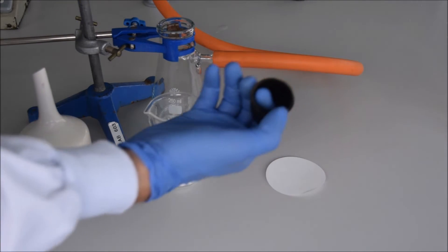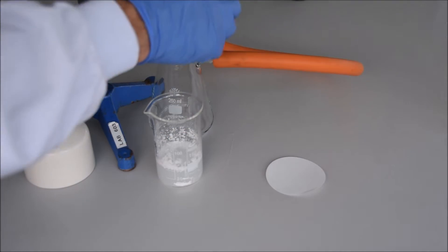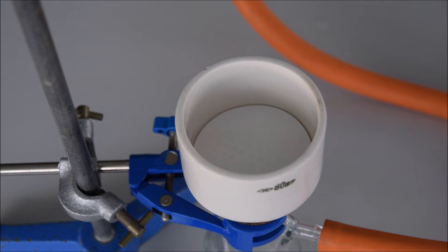Next, pop in your gasket and then put in the funnel itself. Once you've got the funnel in you can put in the filter paper and you're pretty much ready to go. You'll notice that I'm turning the vacuum on and off here, and it's important to have the vacuum running before you start to pour your liquid in, otherwise it'll go down the sides. Another tip for best results is that you should lightly wet the filter paper once it's held by the vacuum with whatever solvent you're going to be filtering through.